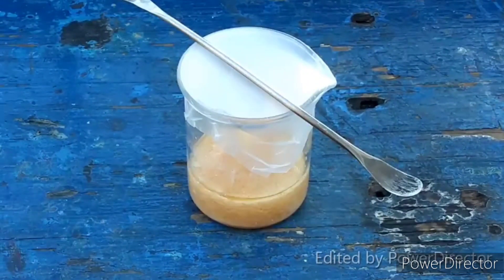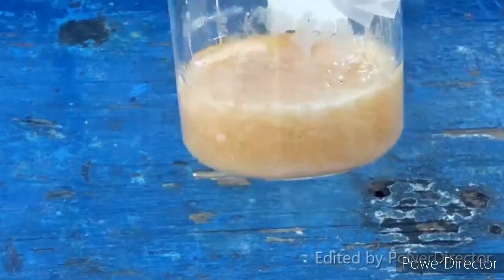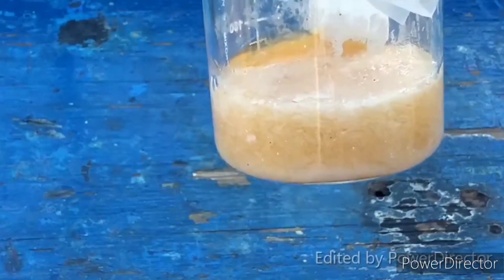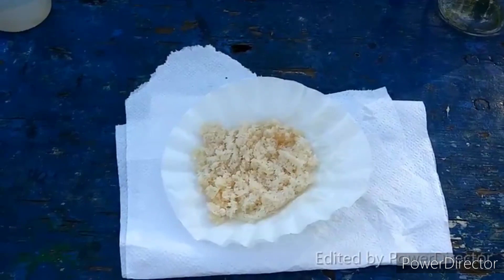I was very dubious that I had gotten much sodium sulfide at all, but look at that. This thing is almost a solid cake — I've already broken it up once. That is awesome. I really was wondering if I was going to get a whole lot of it at all. I'm so happy that it actually worked. And it looks like once we get all that liquid out of it, it might actually be clear-ish. Honestly, I'm just so pleased that it worked. And there you have it — the synthesis of sodium sulfide nonahydrate.